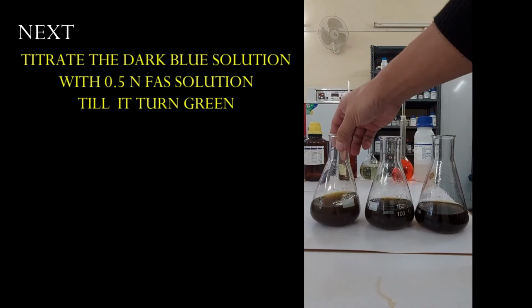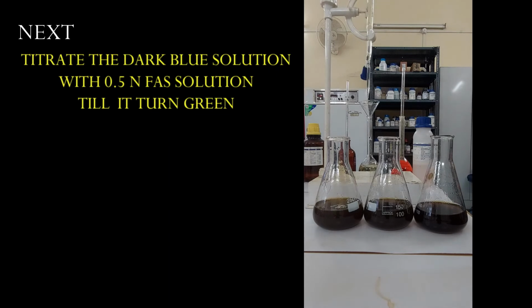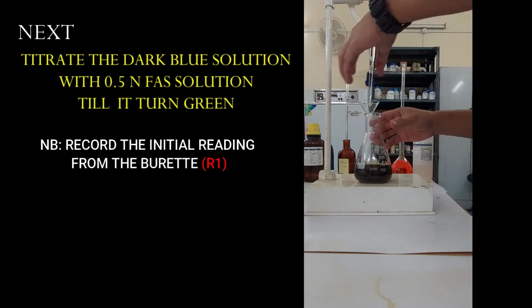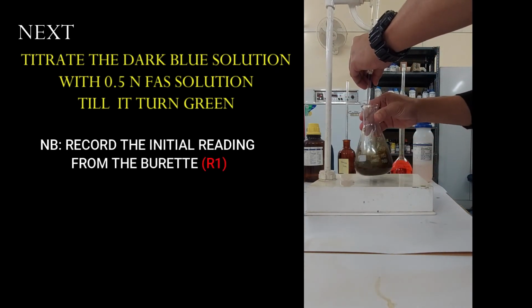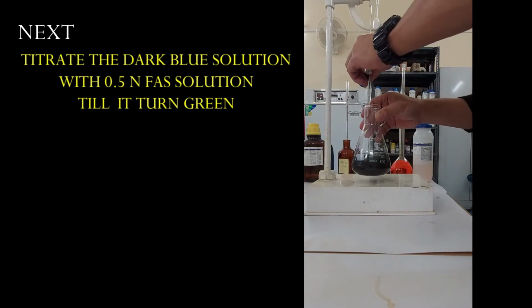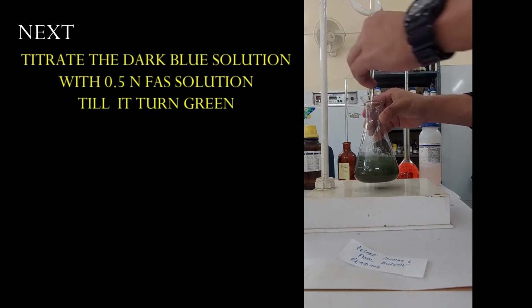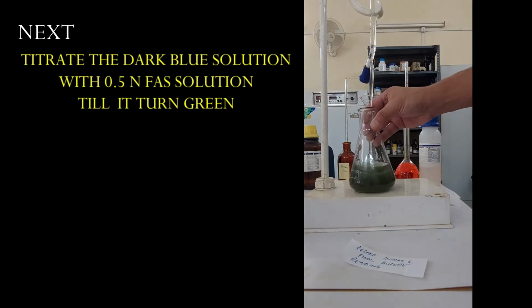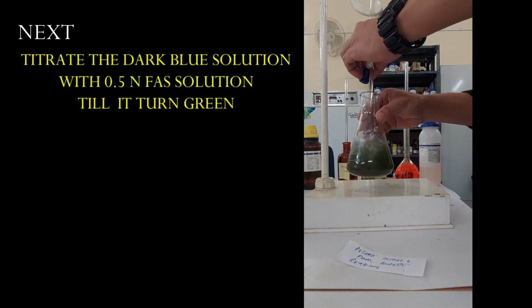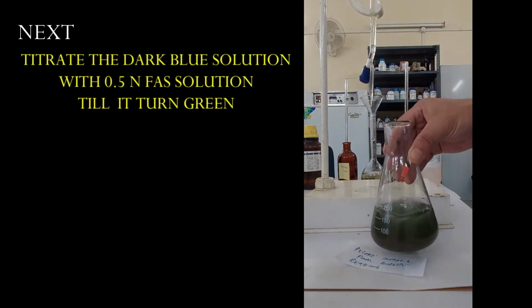Now, titrate the dark blue solution with 0.5 normal ferrous ammonium sulfate solution till it turns green. So always remember to record the initial reading from the burette before you start the titration. Keep adding slowly till the color changes. And after the solution changes into green, remember to record the final reading from the burette.